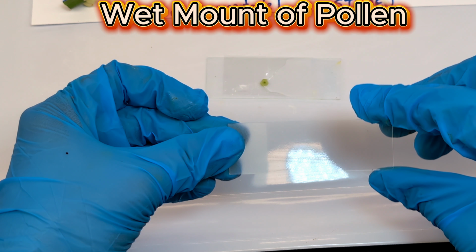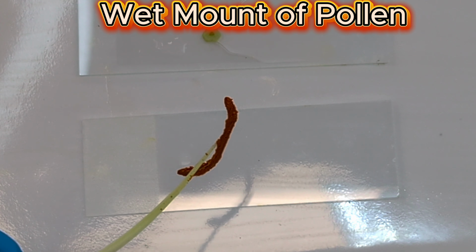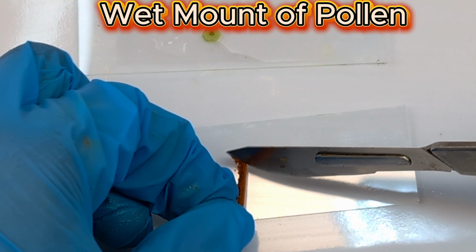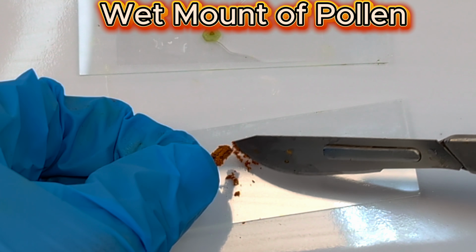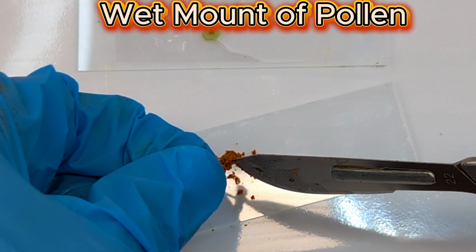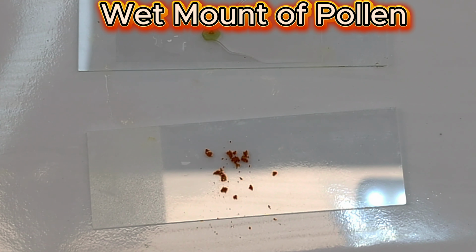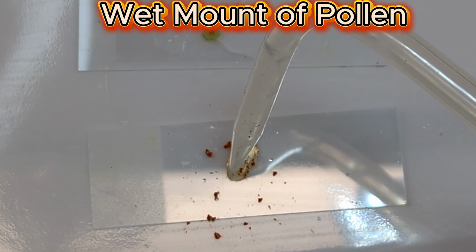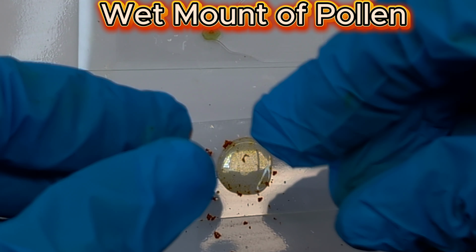Right, and also we can do the same for our pollen. So to create a wet mount for our pollen, again we have a microscope slide. Now you just take one of the anthers and use your scalpel or knife and just lightly scrape off some of the pollen onto your slide like that. And then again, using a dropper or your wash bottle, just add a couple drops of water and then cover with your cover slip.